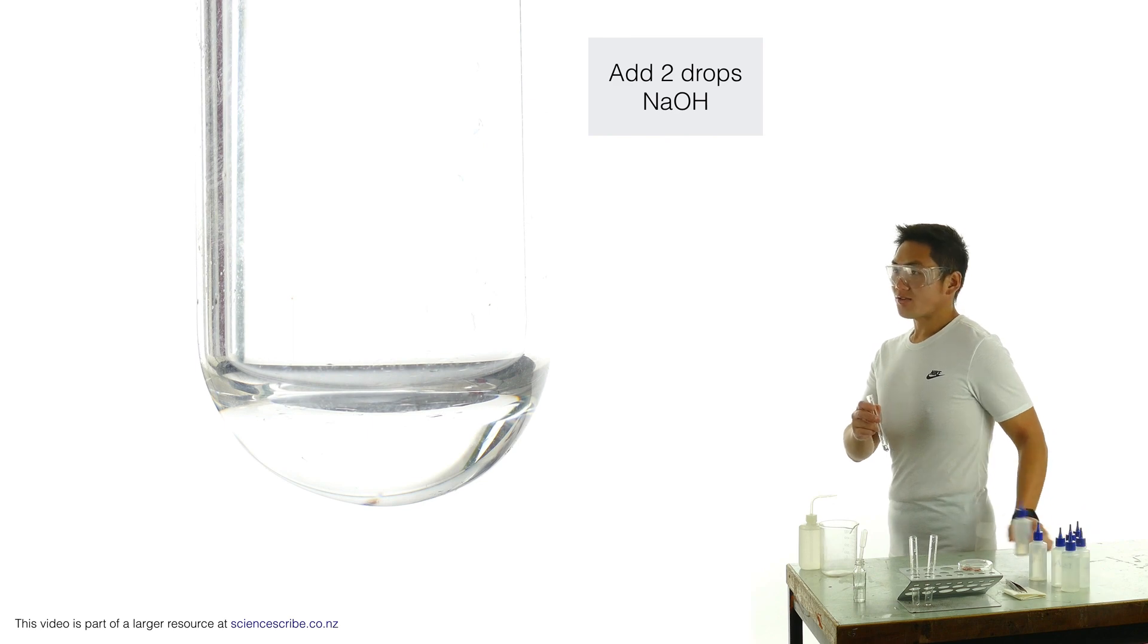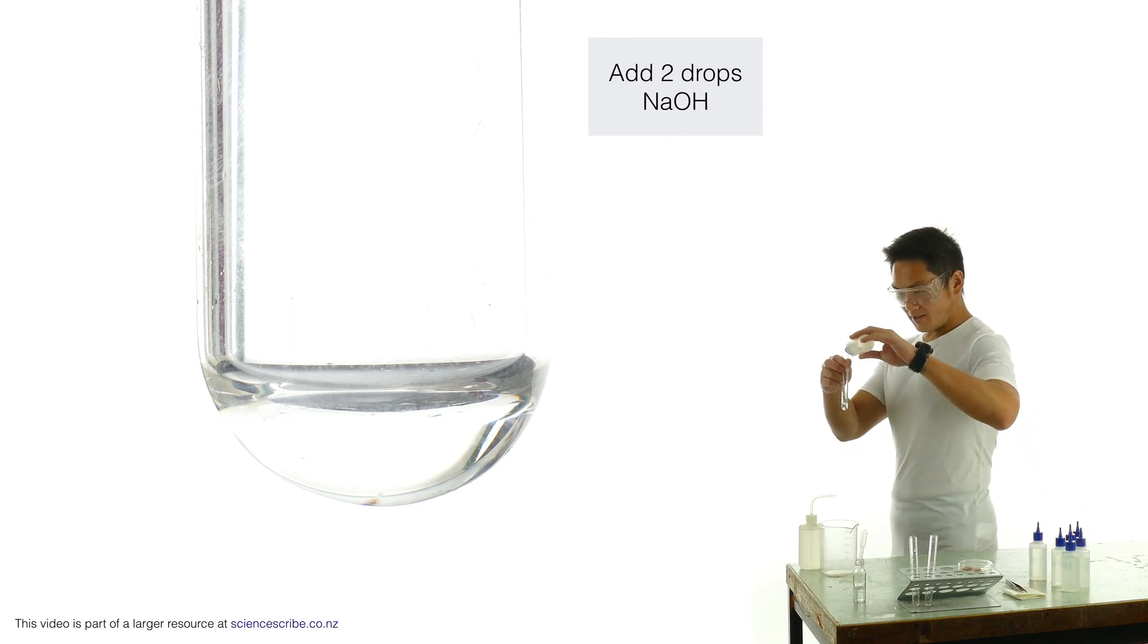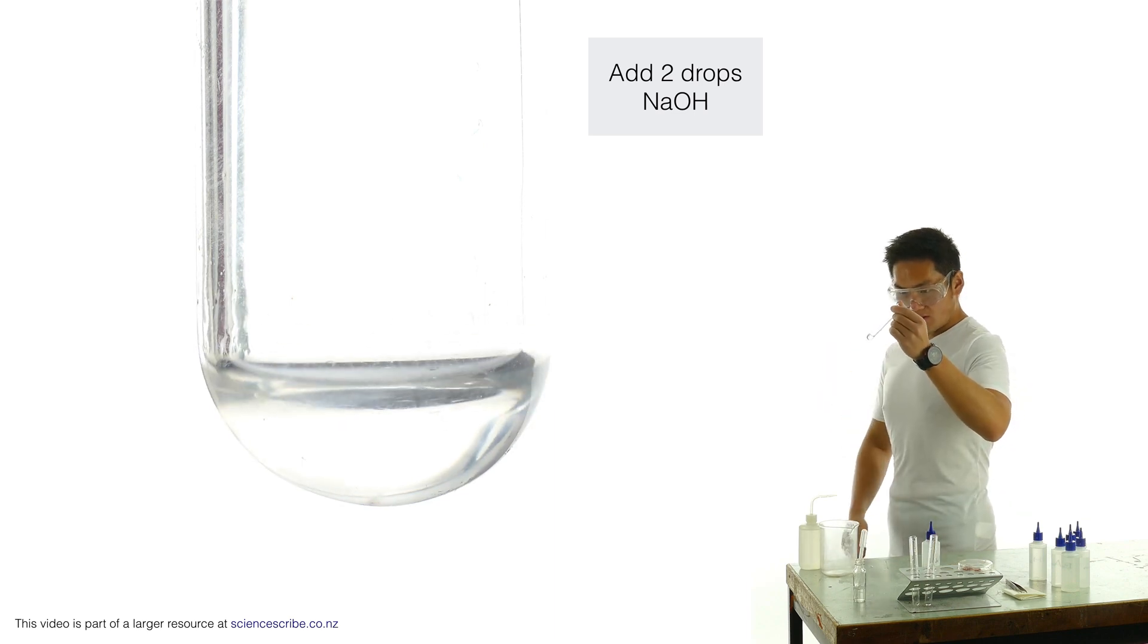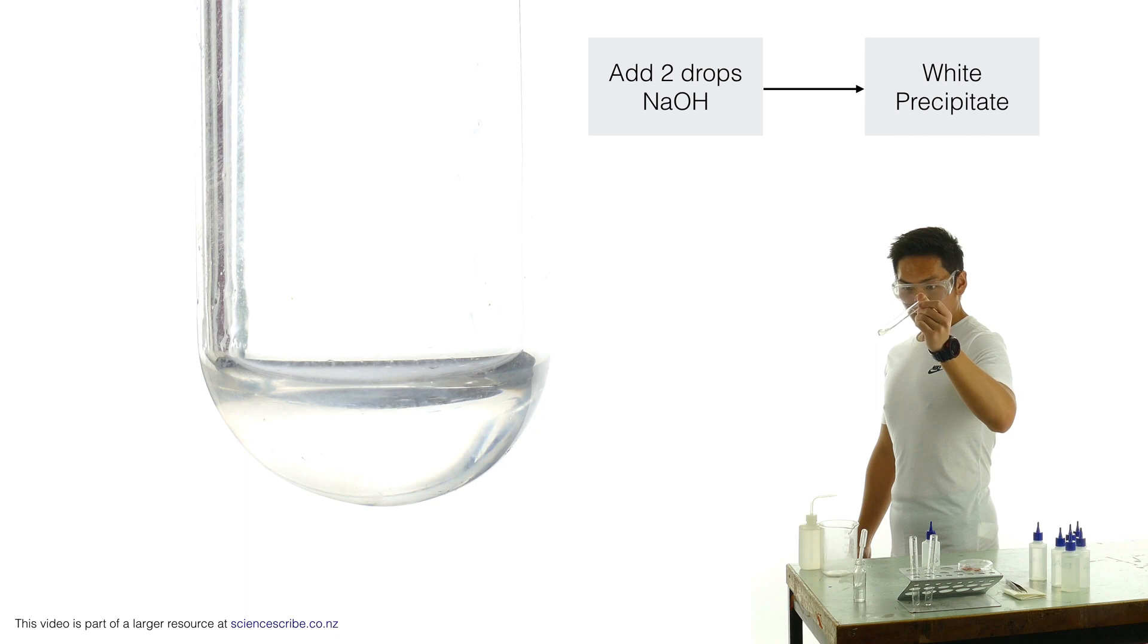Now I'm going to add two drops of sodium hydroxide. Ooh, something faint and cloudy and white has formed.